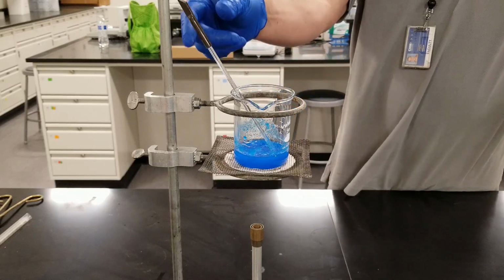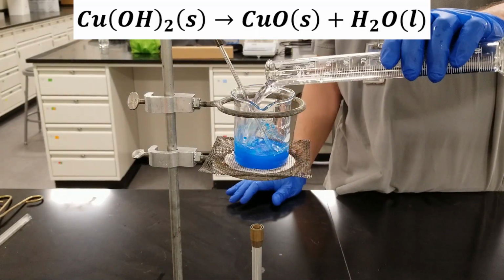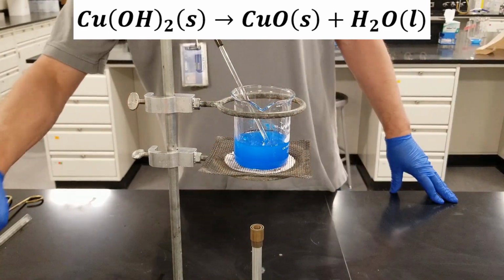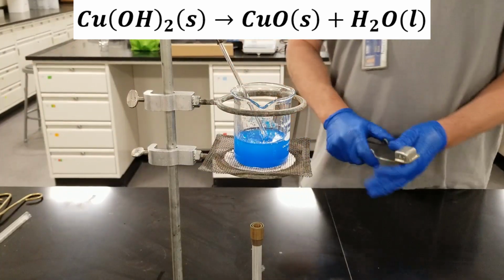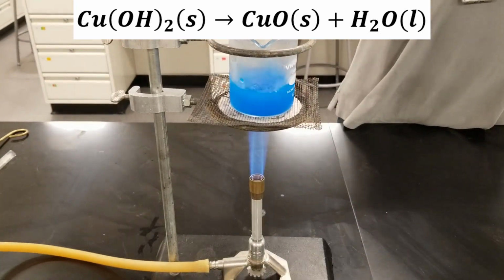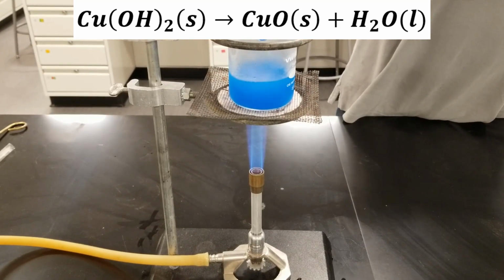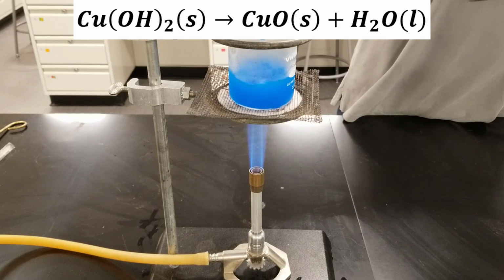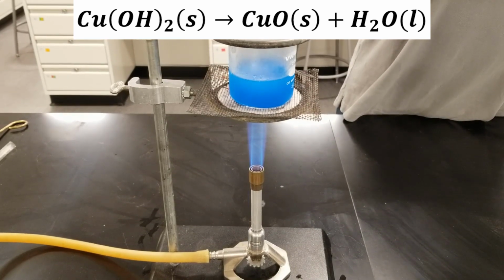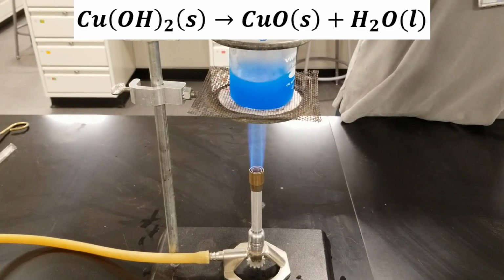Okay, here's our blue sludge of copper hydroxide. We're going to add a little bit more water to it, and we're going to boil it. So we're applying heat, and we're going to get that copper hydroxide to decompose into copper oxide. That's a general property of metal hydroxides.